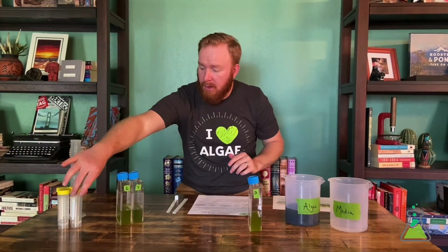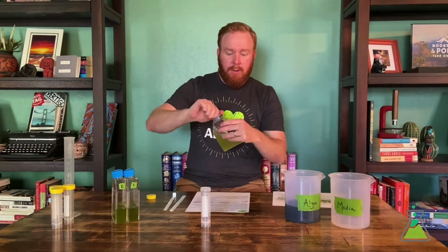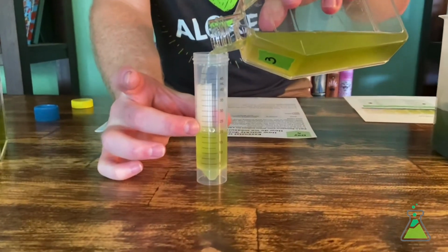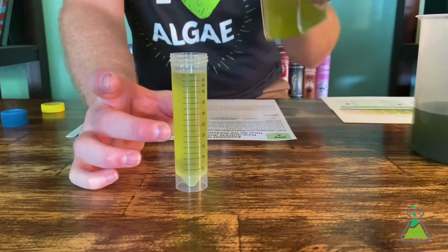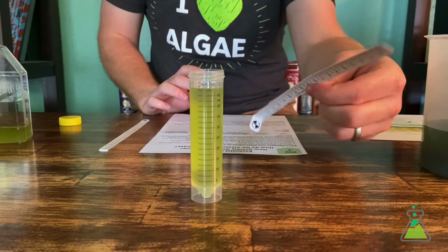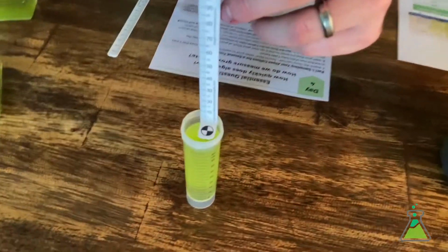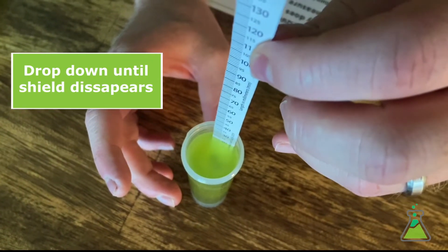So let's get started. We use the skirted Falcon tube, and we're going to shake our algae culture and fill this up here with 50 milliliters of algae. All right, looks good. And then we're going to use, remember, our handy dandy Secchi stick. We're going to watch that shield as we drop it through to determine exactly how much algae is in our culture. So we can keep dropping it.